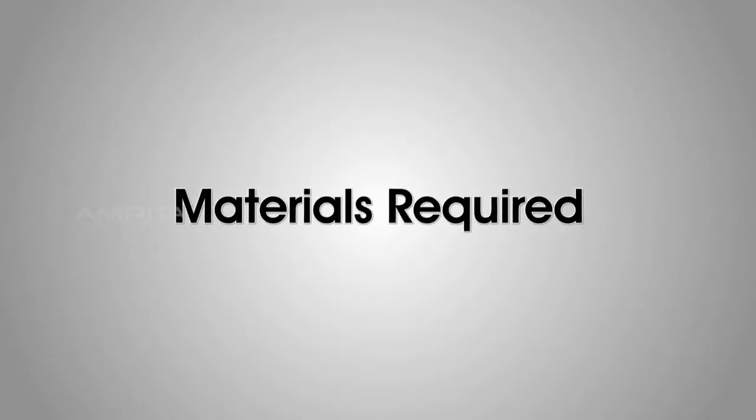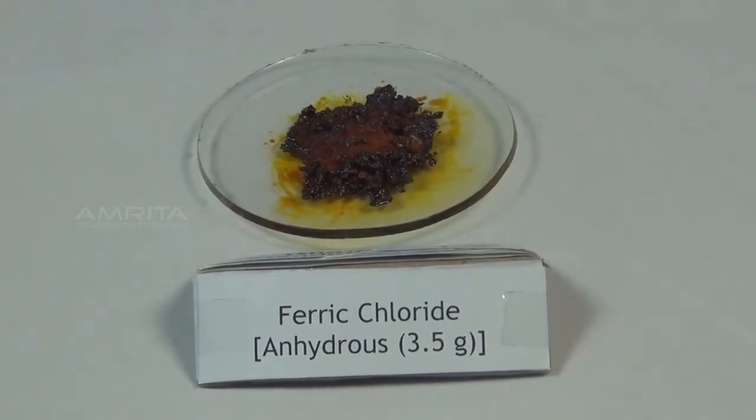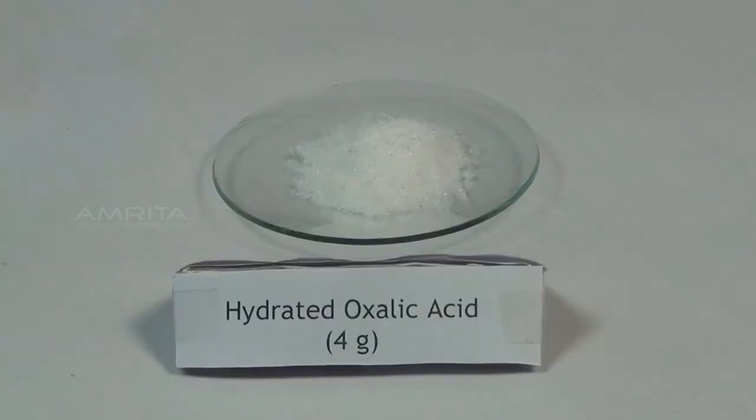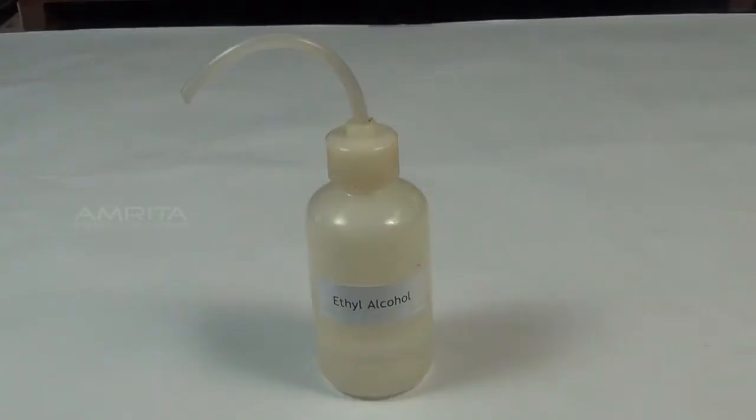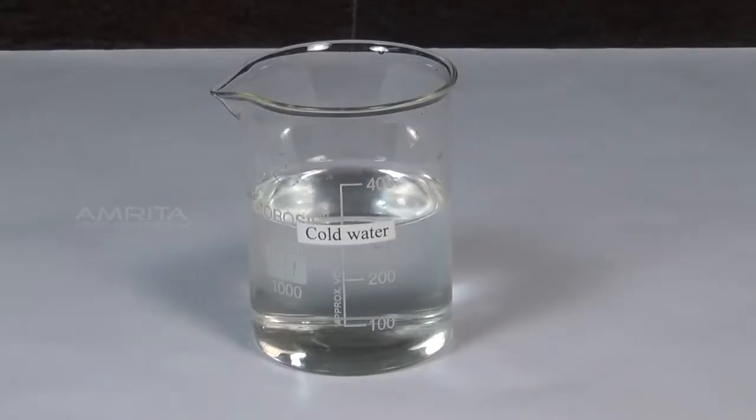Materials required: 3.5 g anhydrous ferric chloride, 4 g potassium hydroxide, 4 g hydrated oxalic acid, 5.5 g hydrated potassium oxalate, ethyl alcohol, distilled water, and cold water.